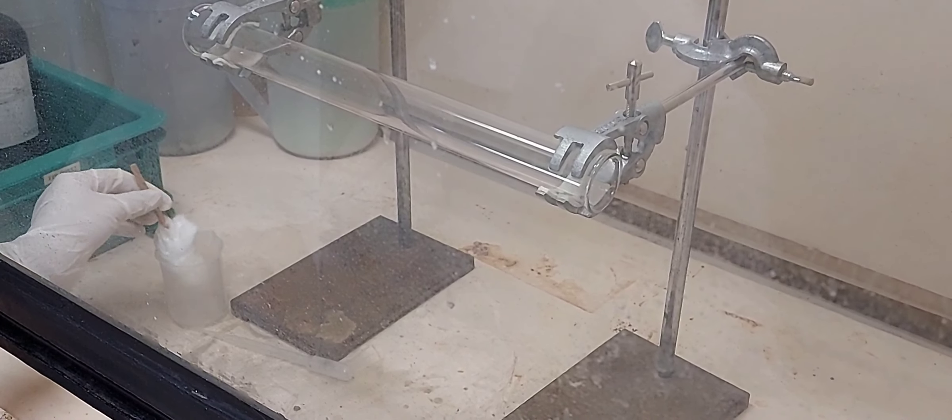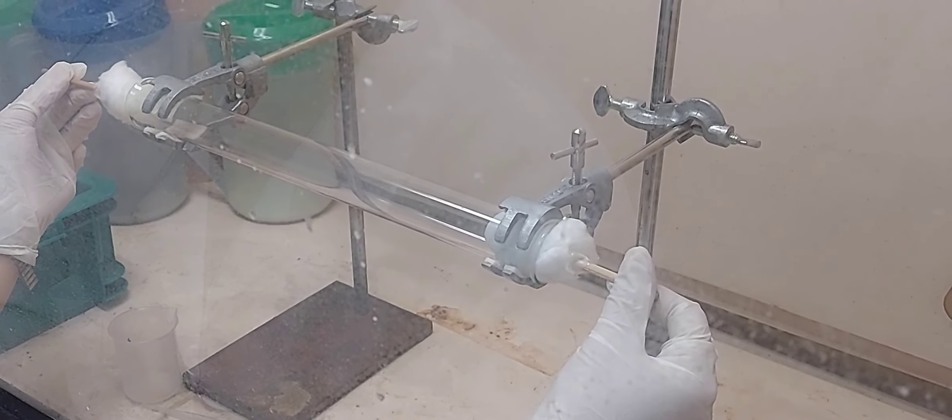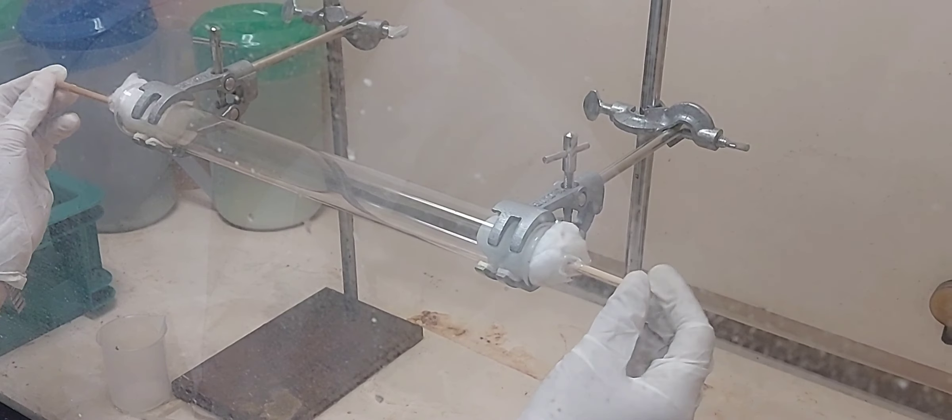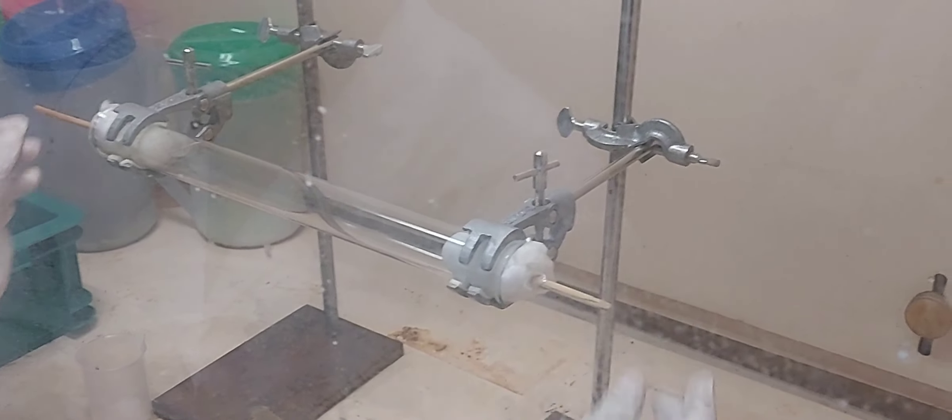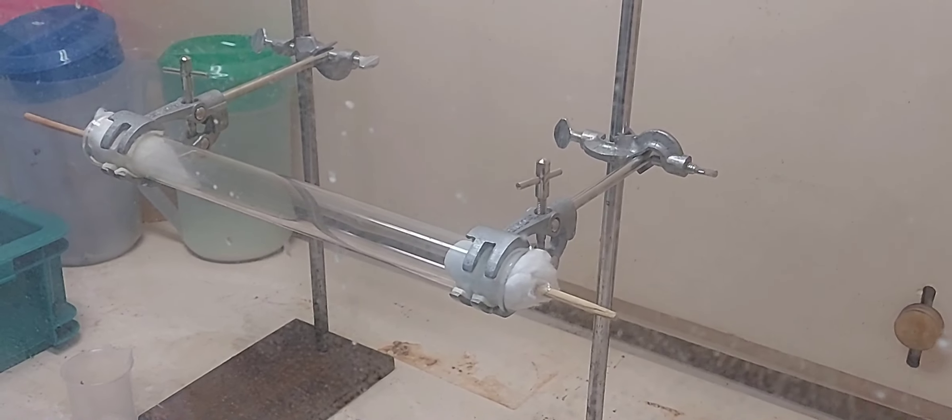So now we will place the cotton balls into the tube which is open at both ends. You see that? And you just make your observations what will happen. You can see the gas fuming.